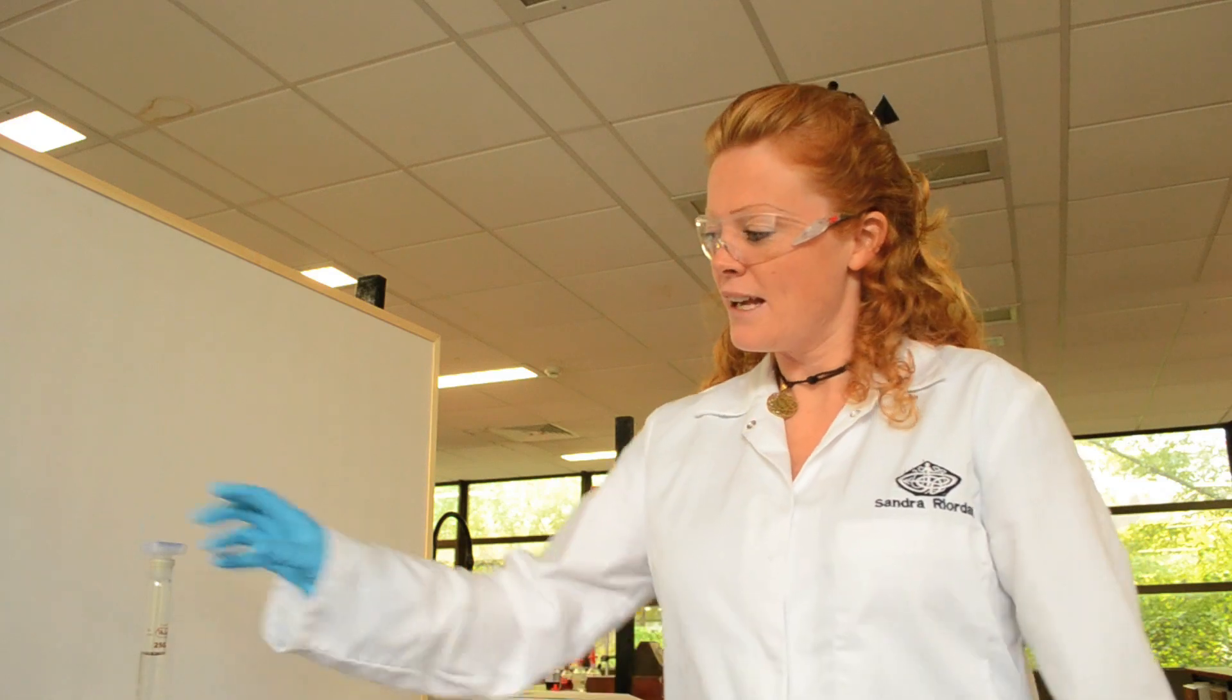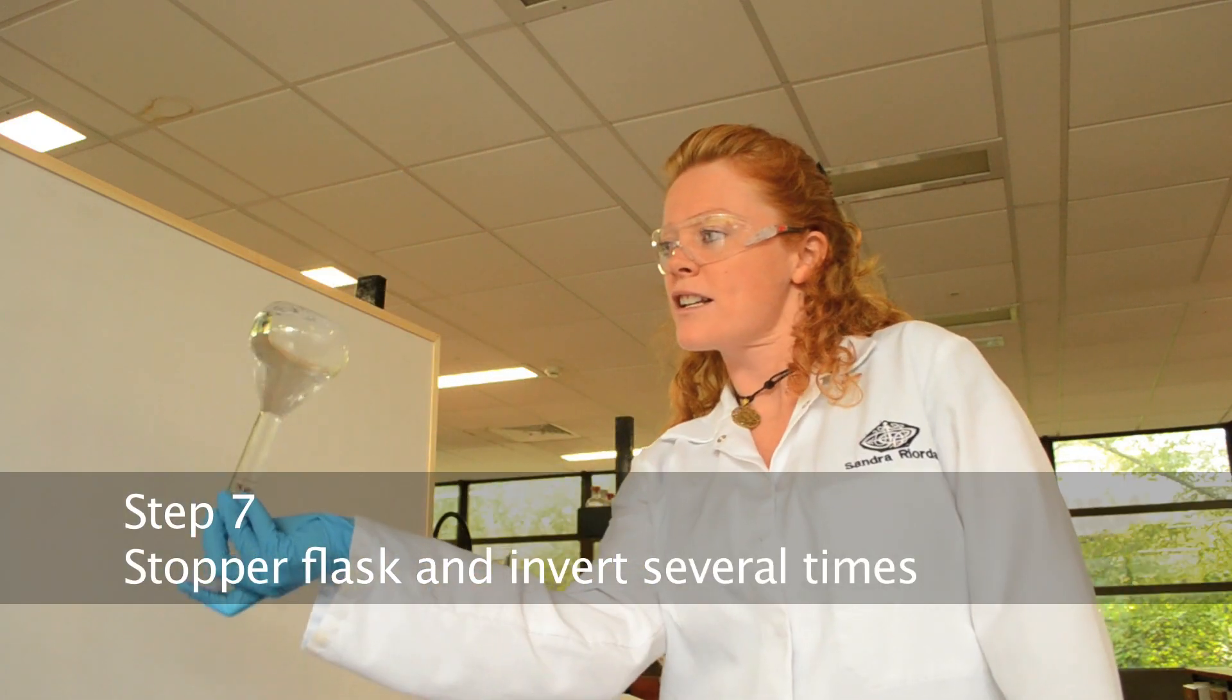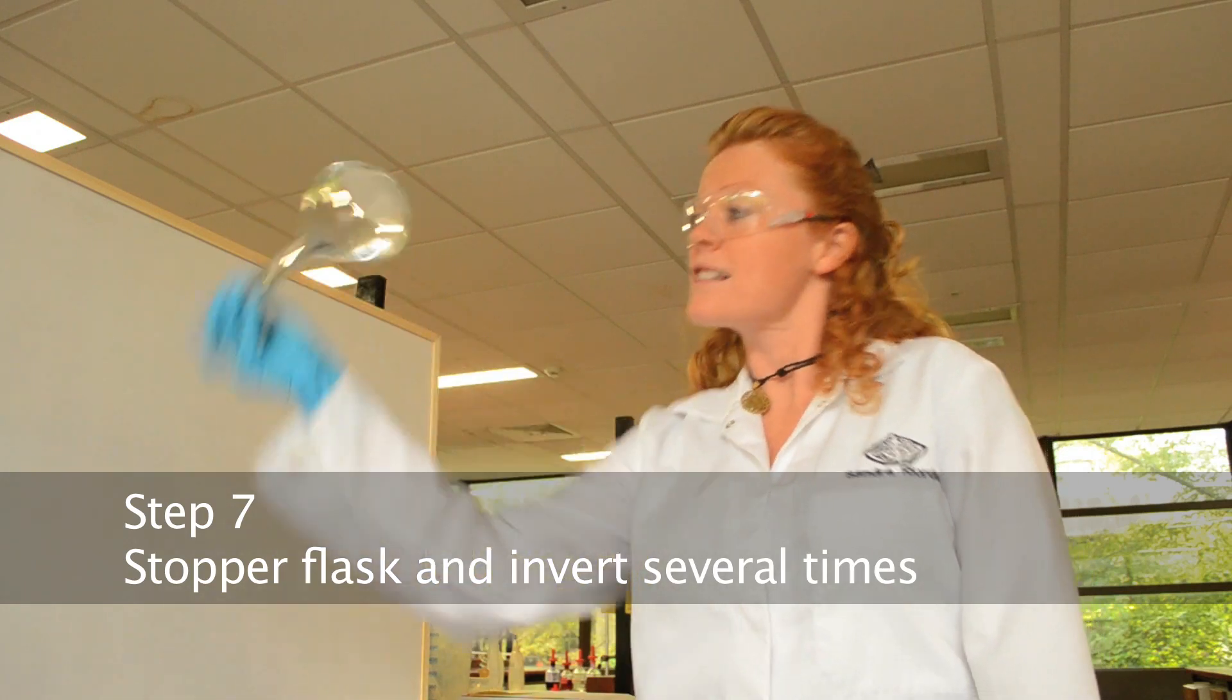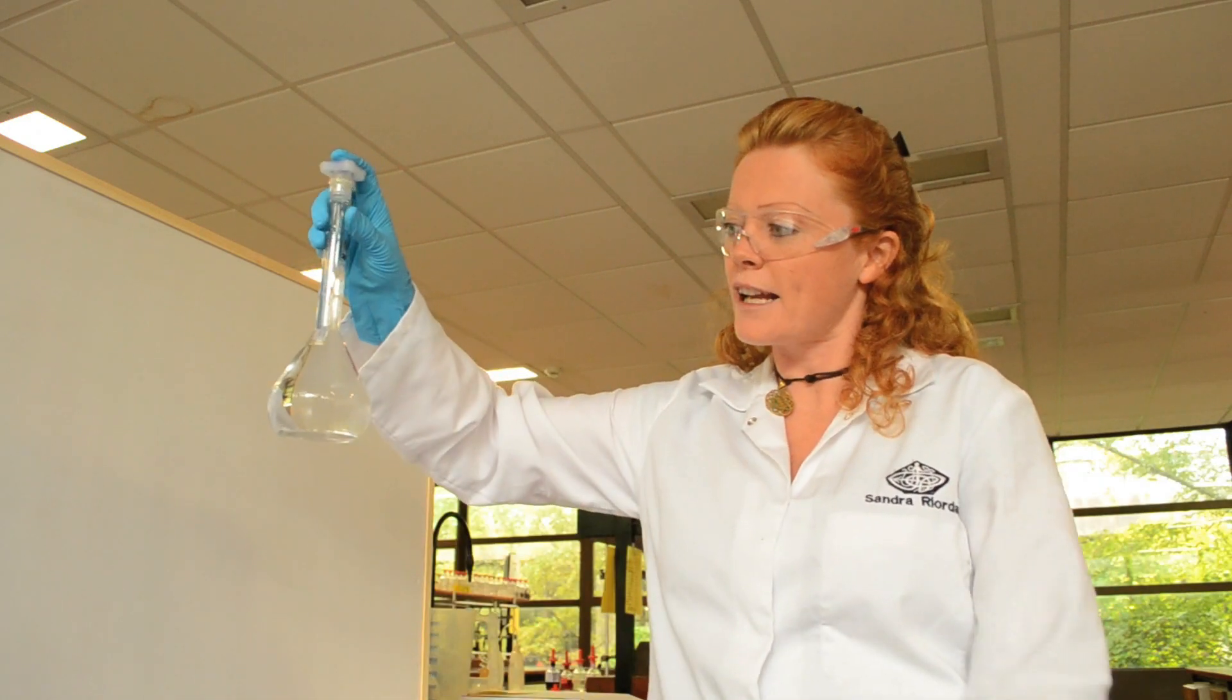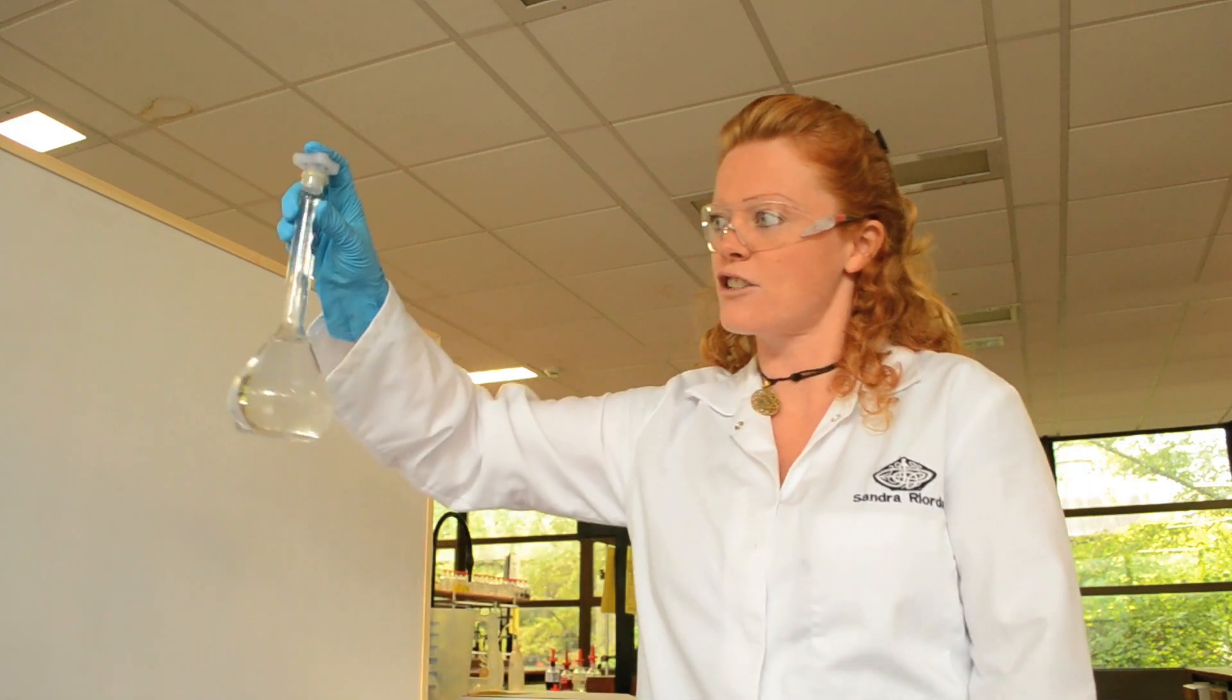There. I've stoppered the volumetric flask, and now I'm going to invert it more than 10 times to ensure that I get a homogeneous solution in the volumetric flask. This is essential for carrying out titrations.